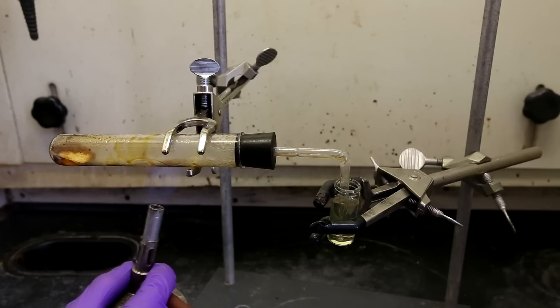If the flame from the Bunsen burner were completely removed from the boiling tube, a suck back will occur. The pressure in the tube will decrease enough that all of the water in the dram vial will be sucked back up into the boiling tube.